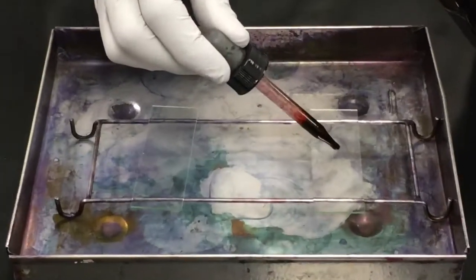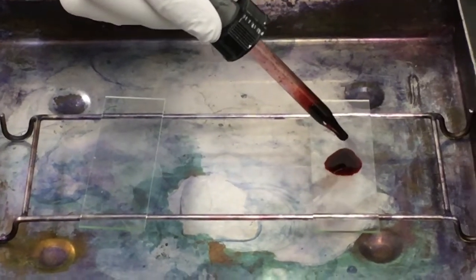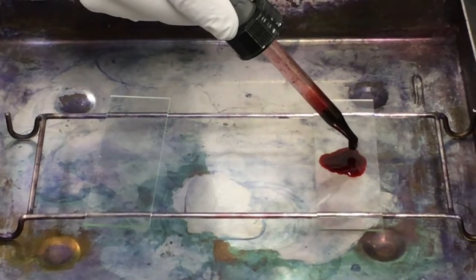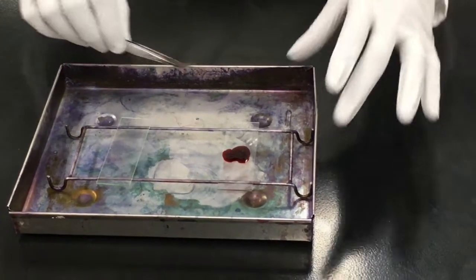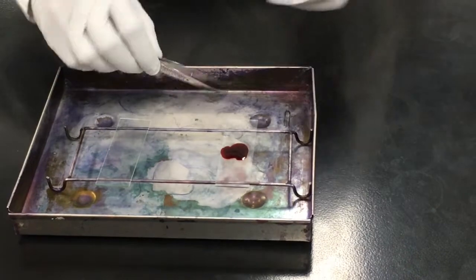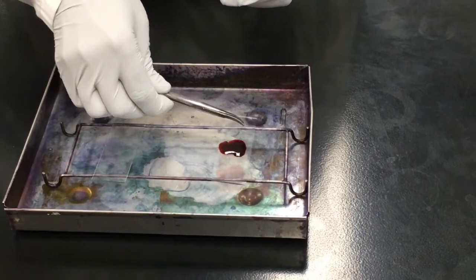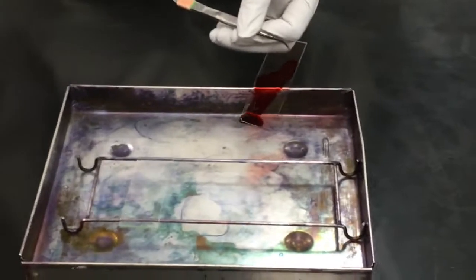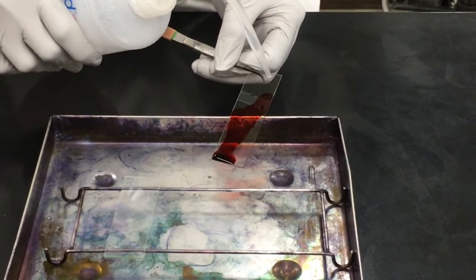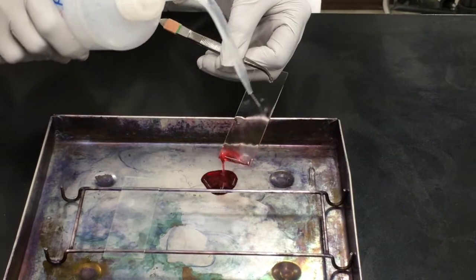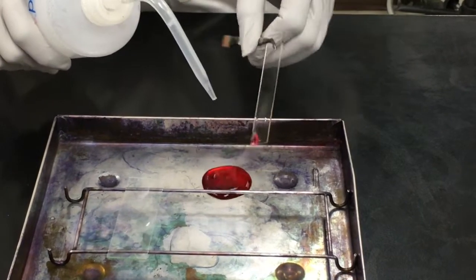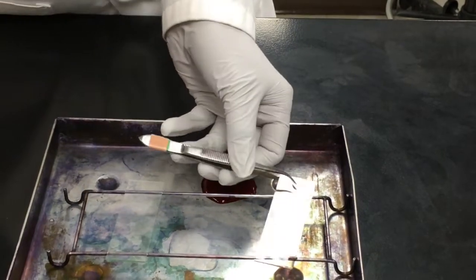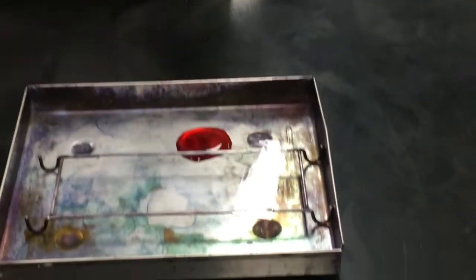When following your staining procedure, it may request that you flood the slide with stain. All that is required is that you completely cover the bacterial smear with stain. Stain in other parts of the slide are really just excess waste. When preparing to rinse your slide, grip your slide with the tweezers and hold at an angle to avoid getting staining on your gloves. Use your distilled water bottle to rinse the slide clean until the stream of water is running clear. Before you are able to view this under a microscope, the slide must be dried either with a Kim wipe or by air and place a cover slip over your smear.